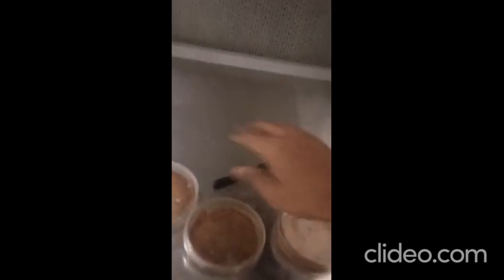And this is the laminar airflow. It is used for the aseptic condition. Here you can see in front there is a HEPA filter, high efficiency particulate air, from which the air comes out, and this is the working area. Firstly we will disinfect this area, and here is the UV light.